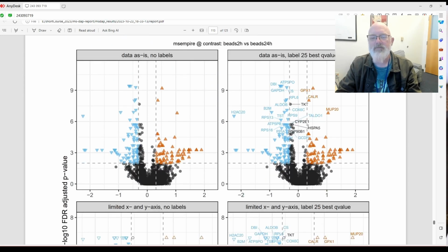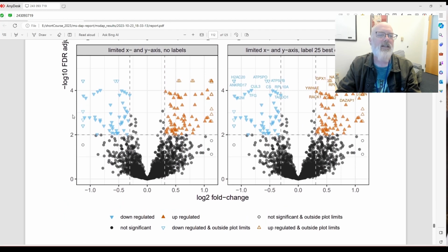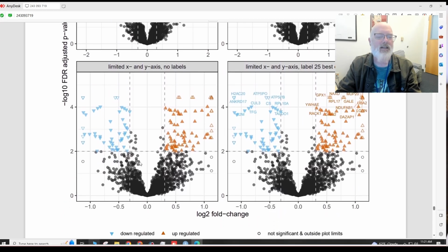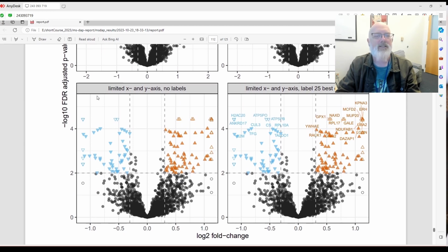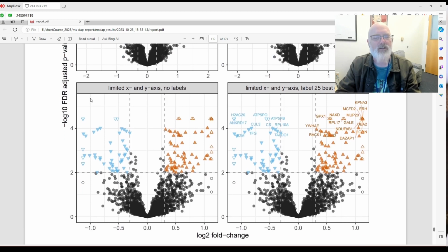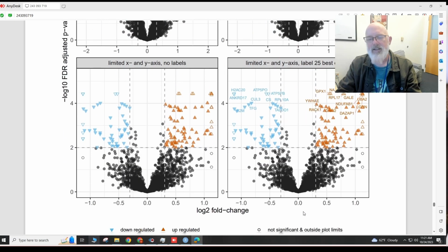We all know what volcano plots are. Basically, this is the log 2 fold change by the log 10 FDR adjusted. So the higher they are in here, the more differentially expressed they are, or the lower the Q value, right? FDR adjusted p-value is a Q value. And then log 2 fold change.